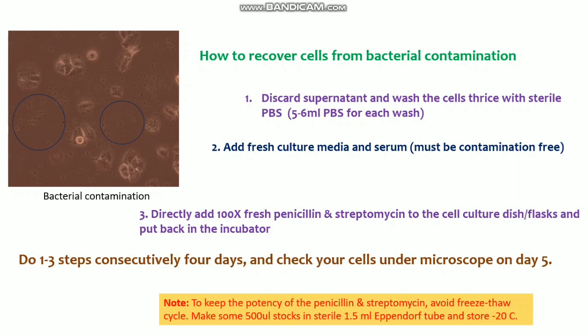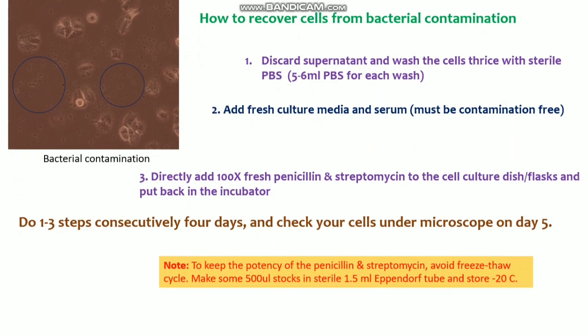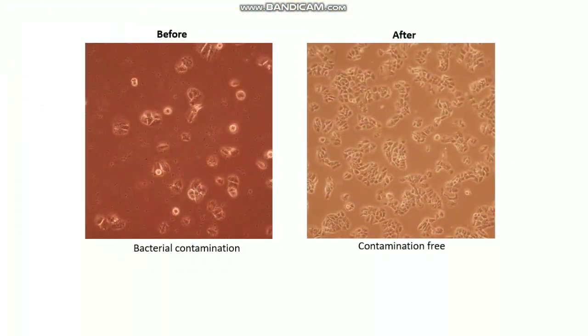So this is all about recovering your cells from bacterial contamination. Here is a picture of my cells that I captured. You see here the before one, which is the bacterial contamination, and I did this for around 4 days. You see here the cells are growing very fast, and the background is very clear, so that is almost contamination free, you can say.